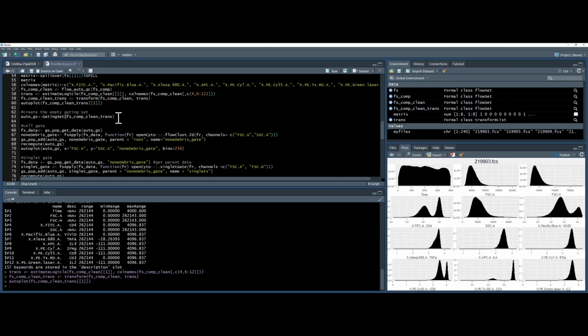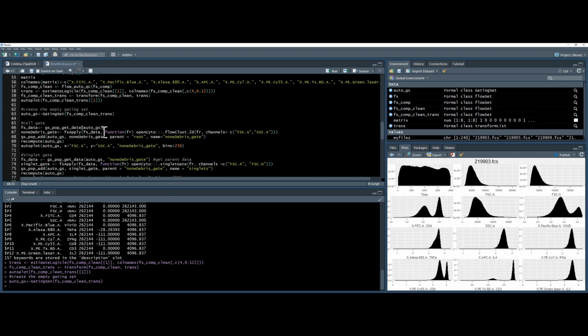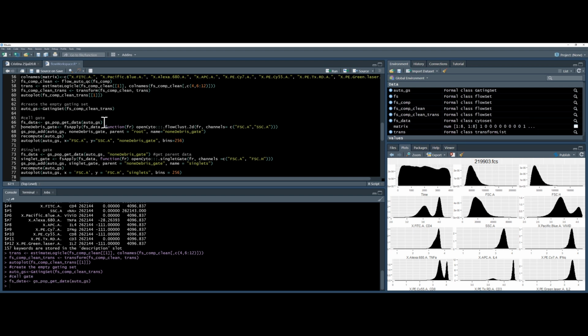Okay, so we're going to do the automated gating. So exactly the same as we did before, just in an automated manner. So again, we're going to create an empty gating set called AutoGS. And then we're going to load data into AutoGS, into FS data, using this GS population get the data command. And so you should read the help documentation about gating sets, because the gating set doesn't contain any actual FCS information. It's just a structure for the gating information. So whenever you want to analyze your data in a gating set, you actually have to load the data first. And we'll discuss this again later on in the statistics section.